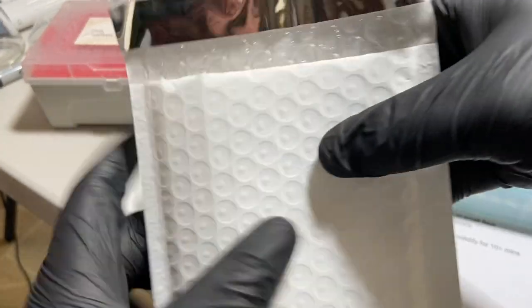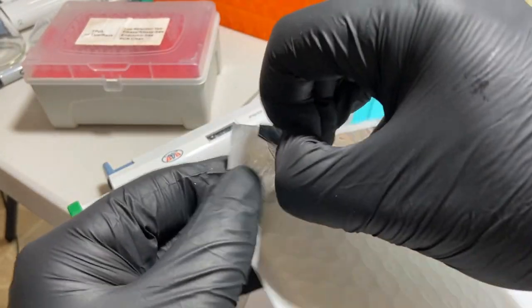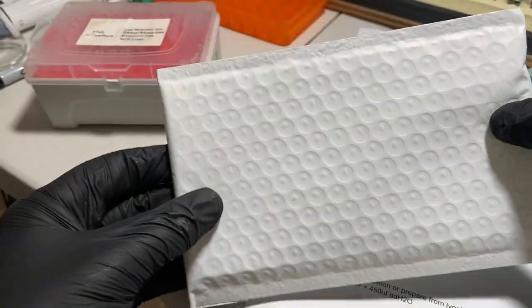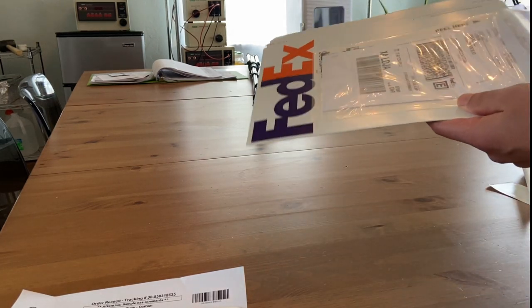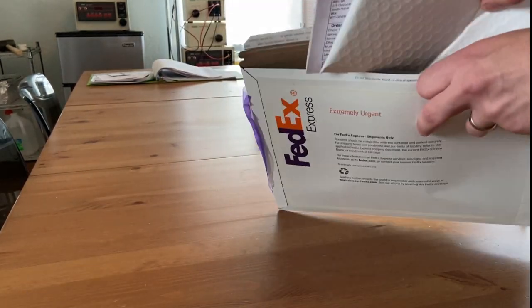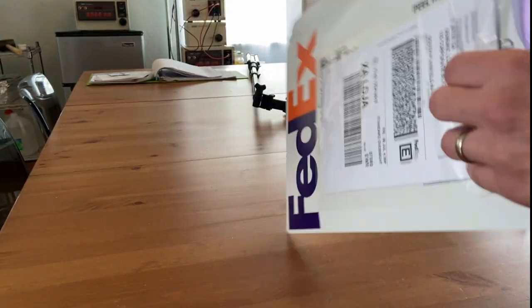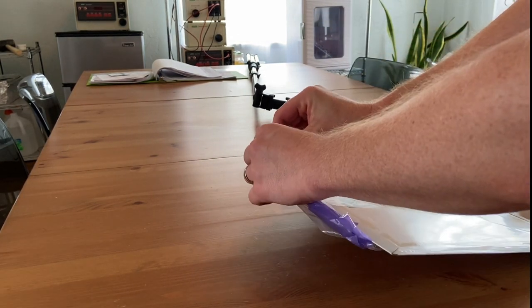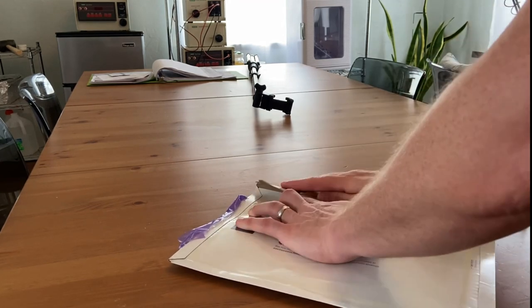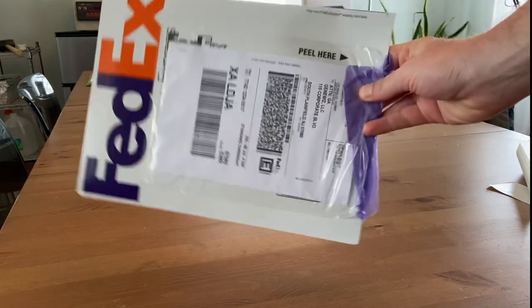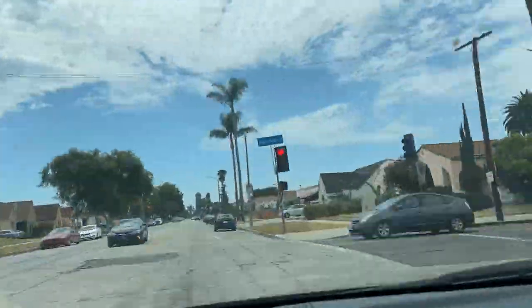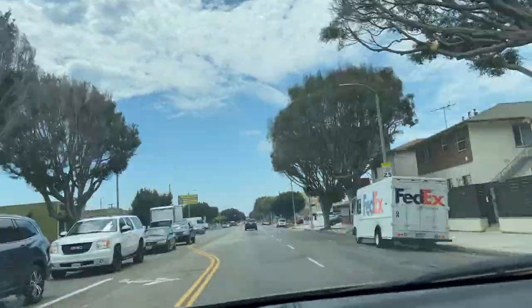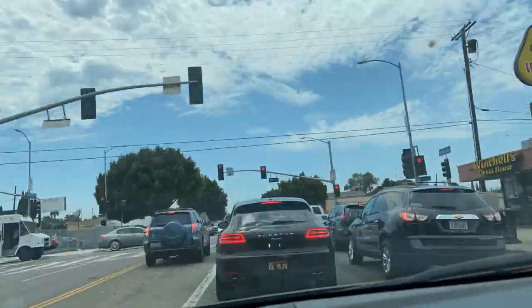And then I like to drop it into a padded envelope that will then go inside of the FedEx overnight envelope. If you do decide to do sequencing through GeneWiz, you can reach out to a GeneWiz account representative and get the FedEx account number so that when you want to overnight a PCR reaction for sequencing, you can bill the overnight shipping charges to the GeneWiz billing account. So here I'm just preparing the FedEx package by putting that padded envelope along with the printed tracking page inside of it. And the next step will be to journey to the FedEx facility and drop this off.